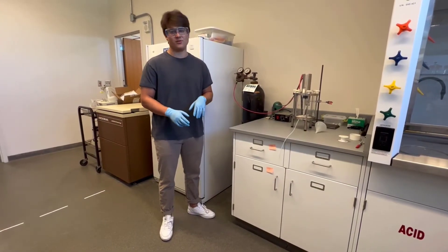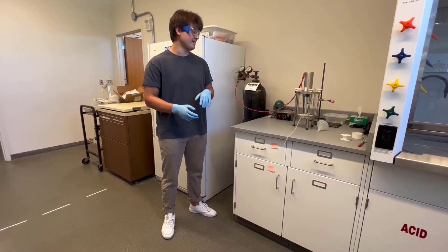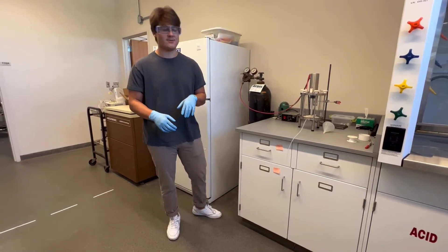Hello everybody, this is going to be a quick overview of our ultrafiltration setup that we have in the lab for your ultrafiltration experiments this semester.